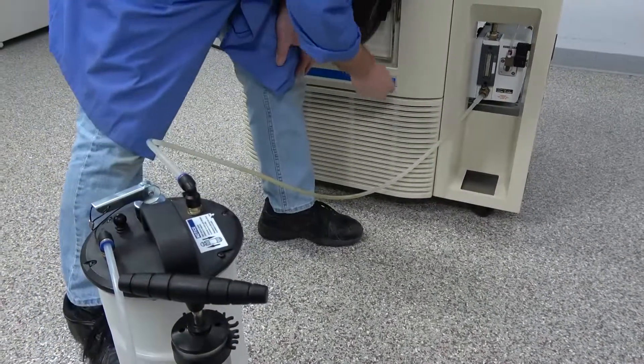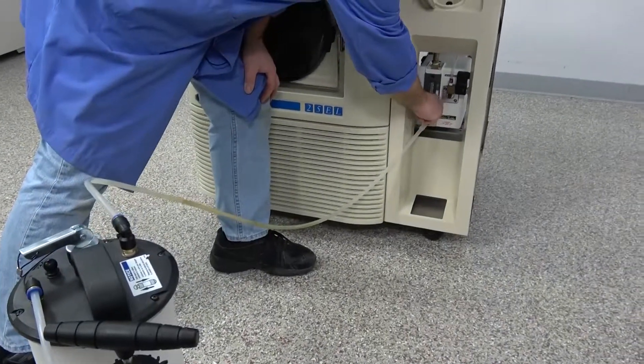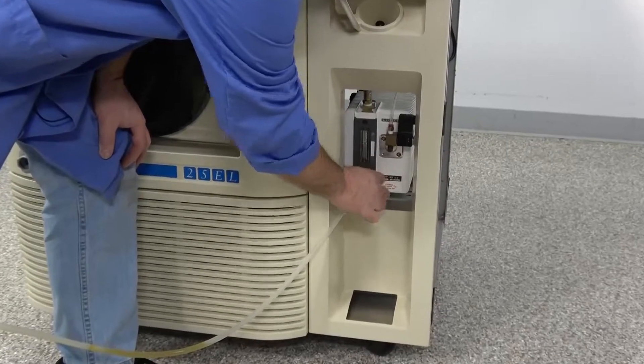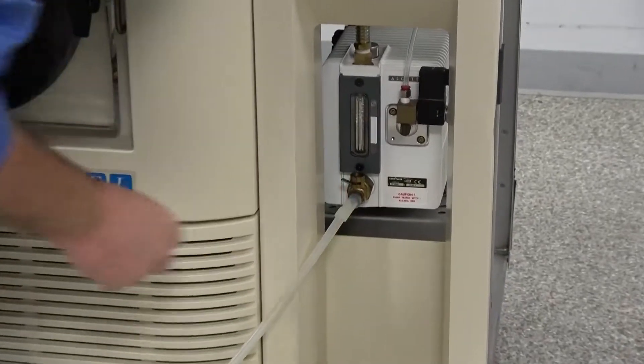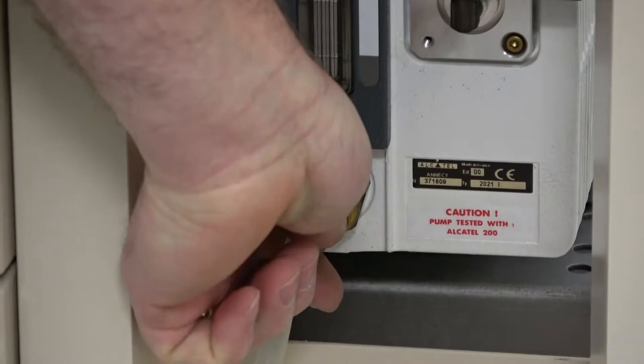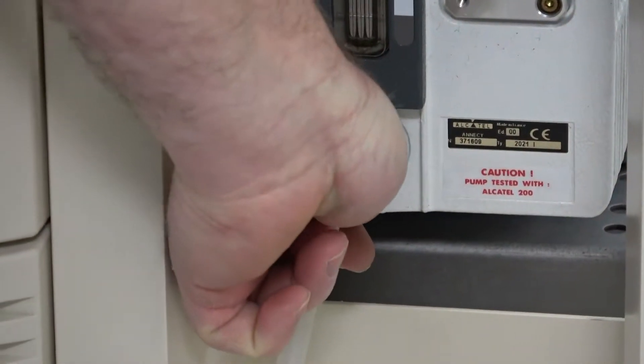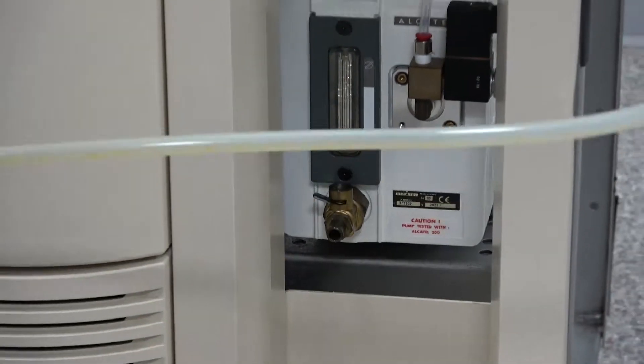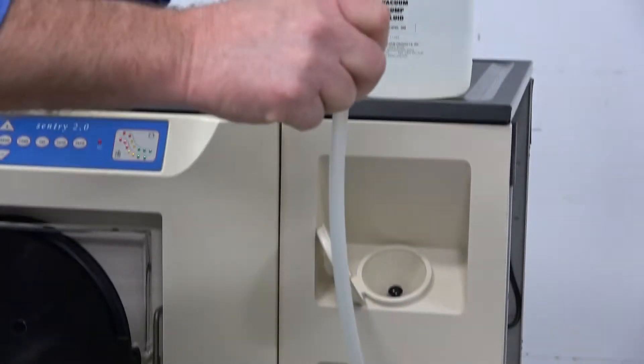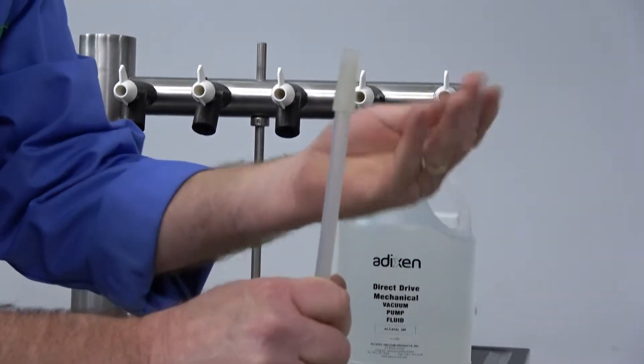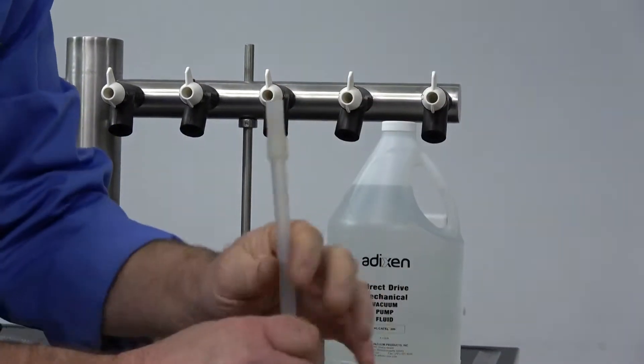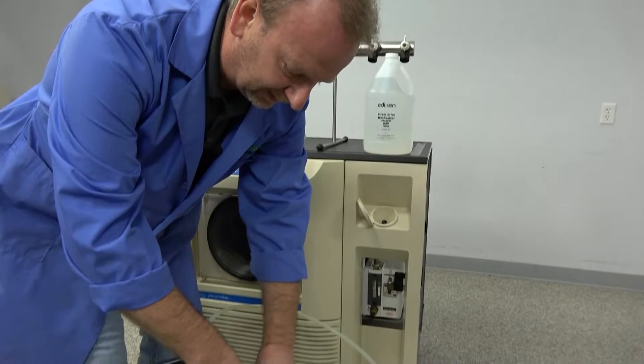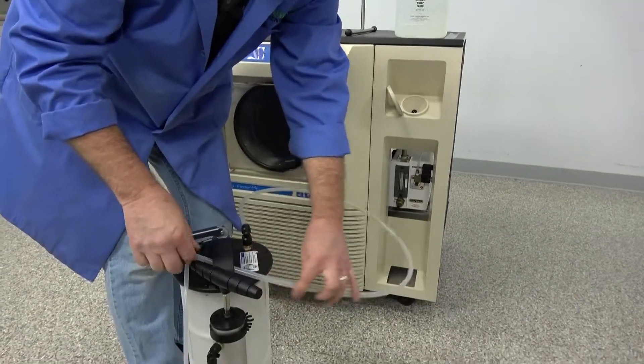So it looks pretty good. And then we just close off the valve here. Lock it. It has a little locking mechanism that we only just put in there. And as I'm unplugging this I'm just going to give it a little bit of a vacuum so that it can kind of just suck all my residue. Now isn't that beautiful? There's absolutely no oil. Nothing. It's just sucked it right into the tube. You know I can't stand oil drips and everything coming in. So just a really awesome way to change the oil.